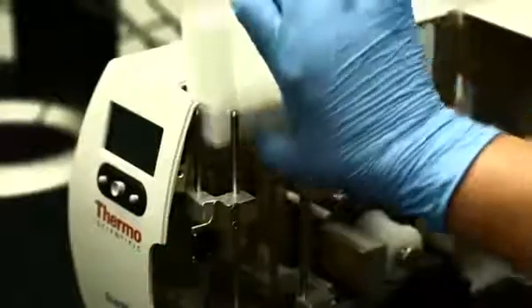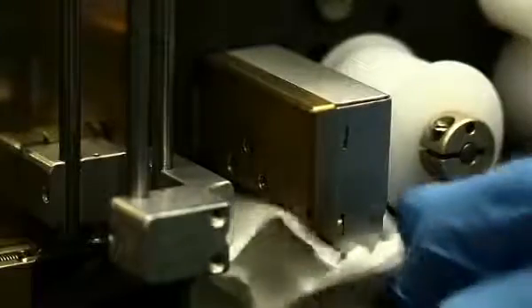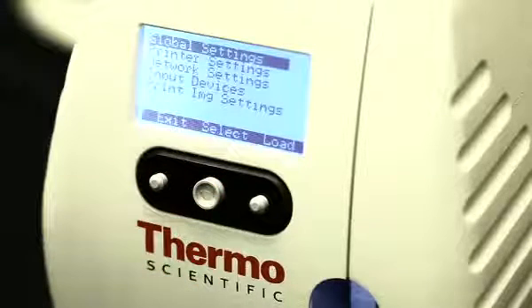Topics to be covered include tips on loading slides, changing the ribbon, and proper cleaning techniques. We will cover steps to take in troubleshooting and resolving issues so as to return the instrument to service with minimal disruption.